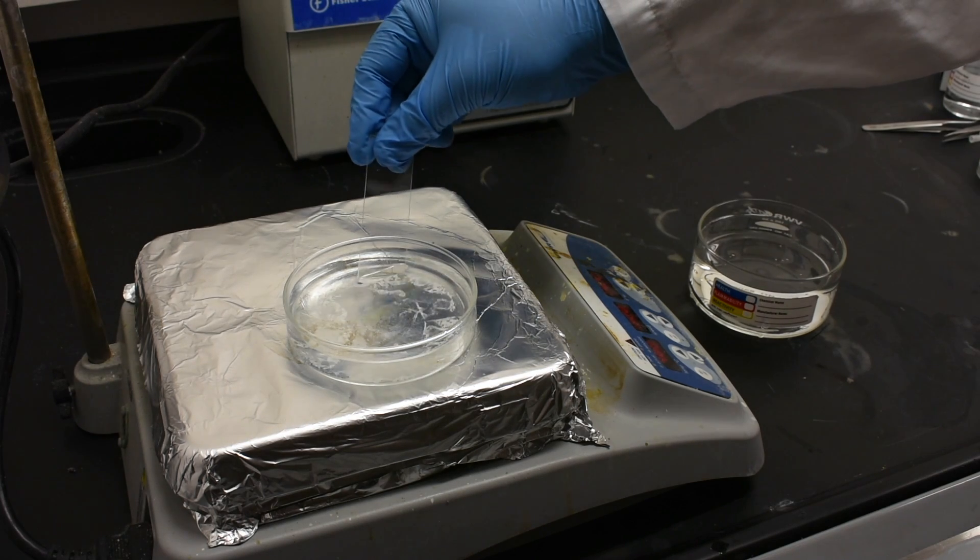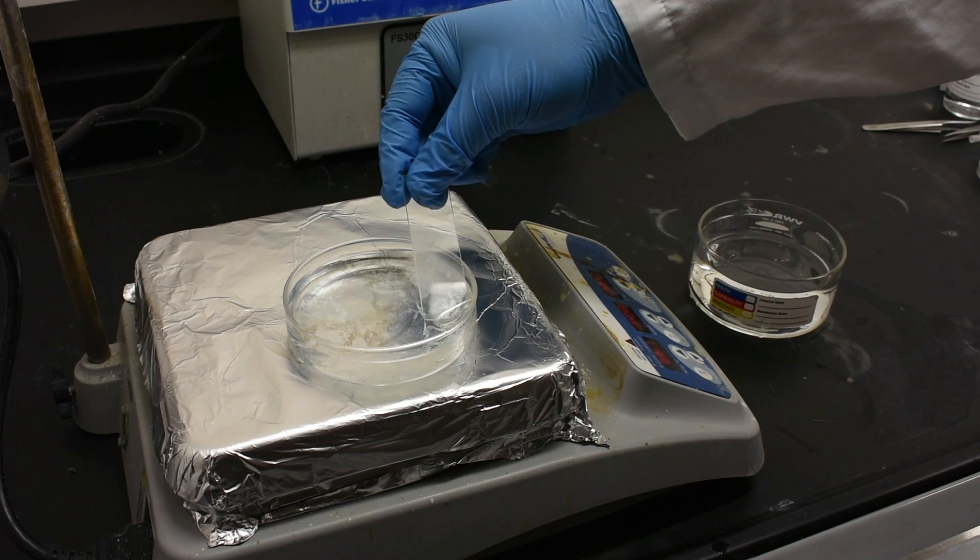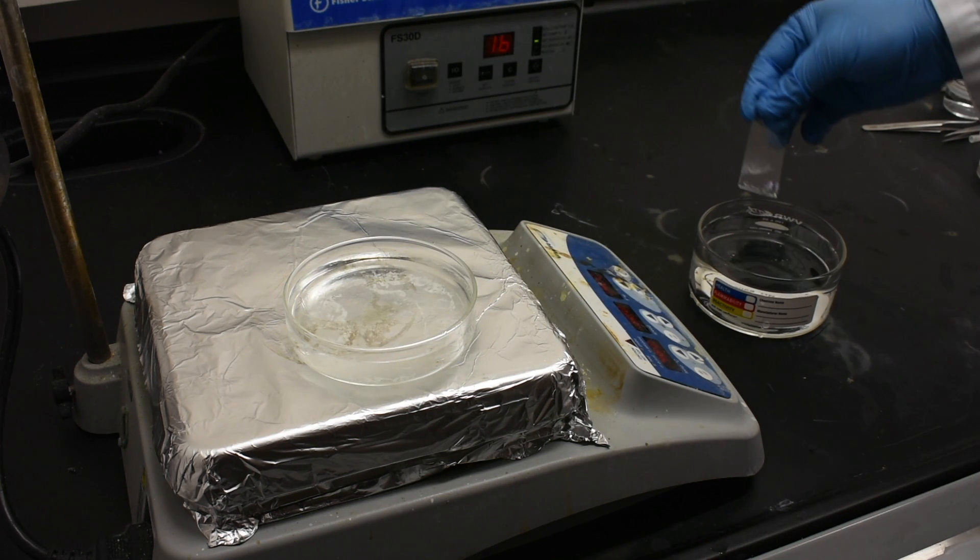If we have used sodium hydroxide, we use a glass slide to transfer our sample from the delamination bath to a DI water rinse.